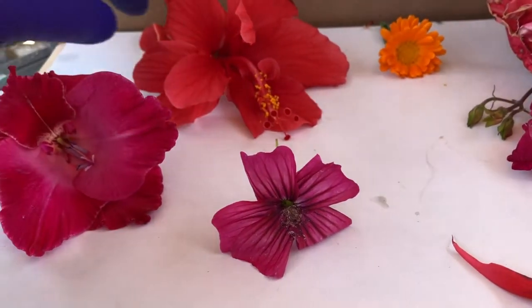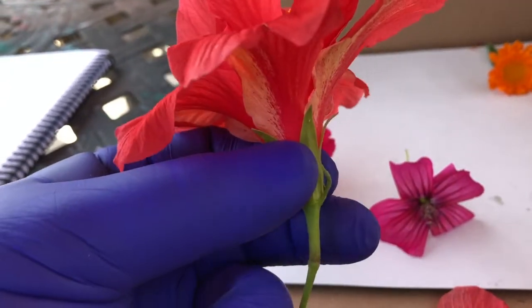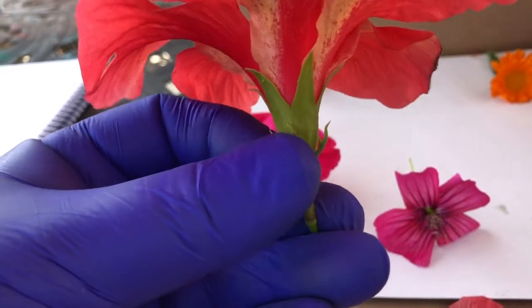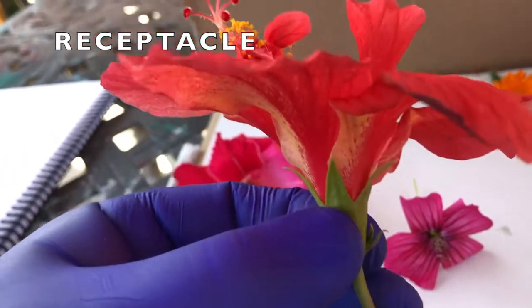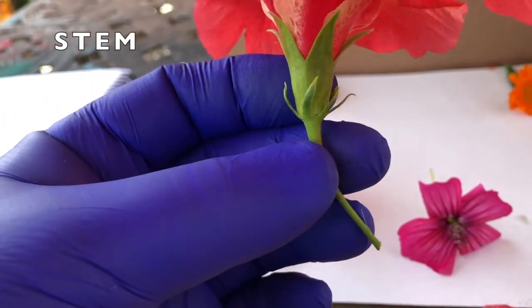I'd like to start off. We're going to be working with this flower today only because it's a lot easier to work with. On the exterior of it, I want to show you the stem here, this green stem that leads up to what they call the receptacle. And the receptacle is basically the base in which everything in this flower is held in like a cup. And this stem would connect to the rest of the plant, of course.